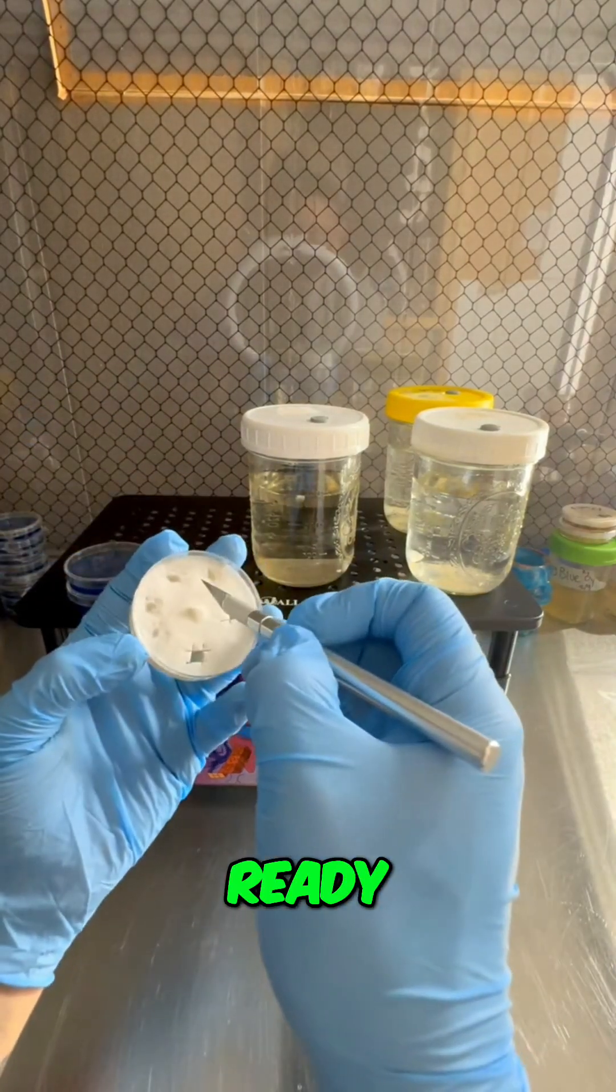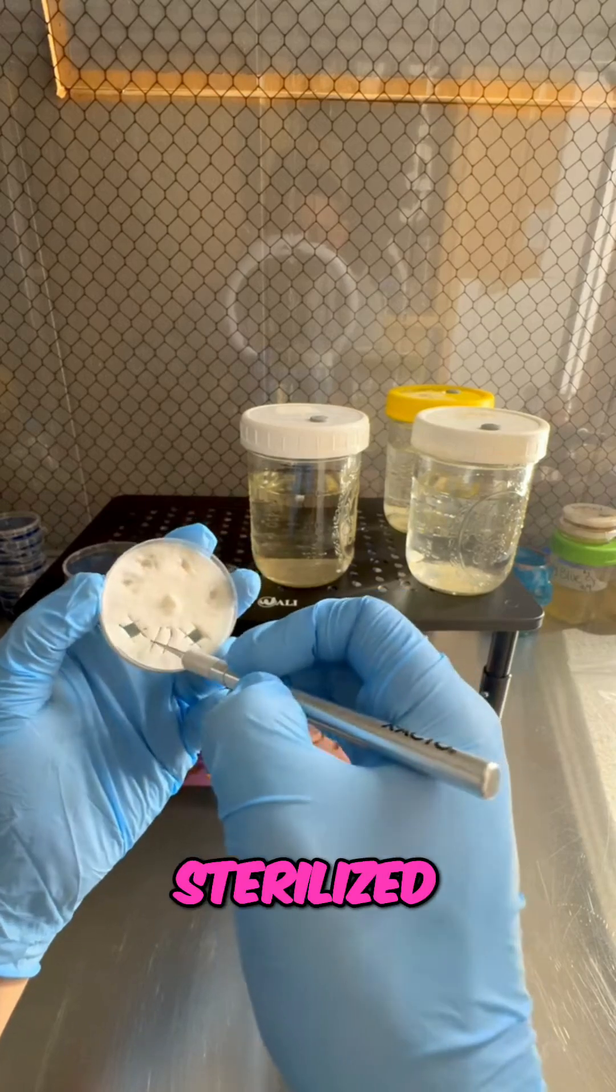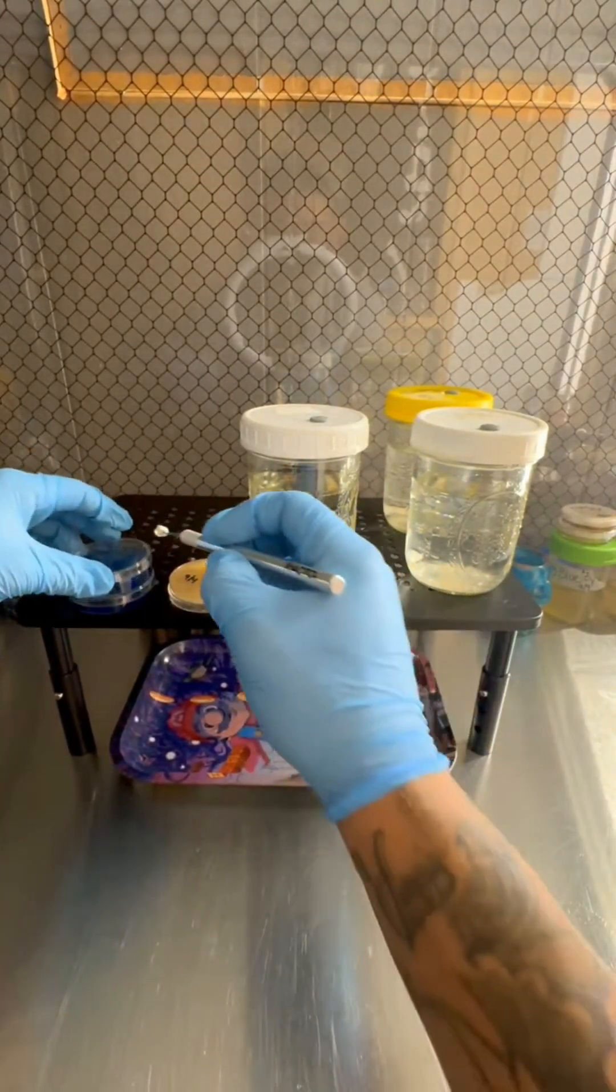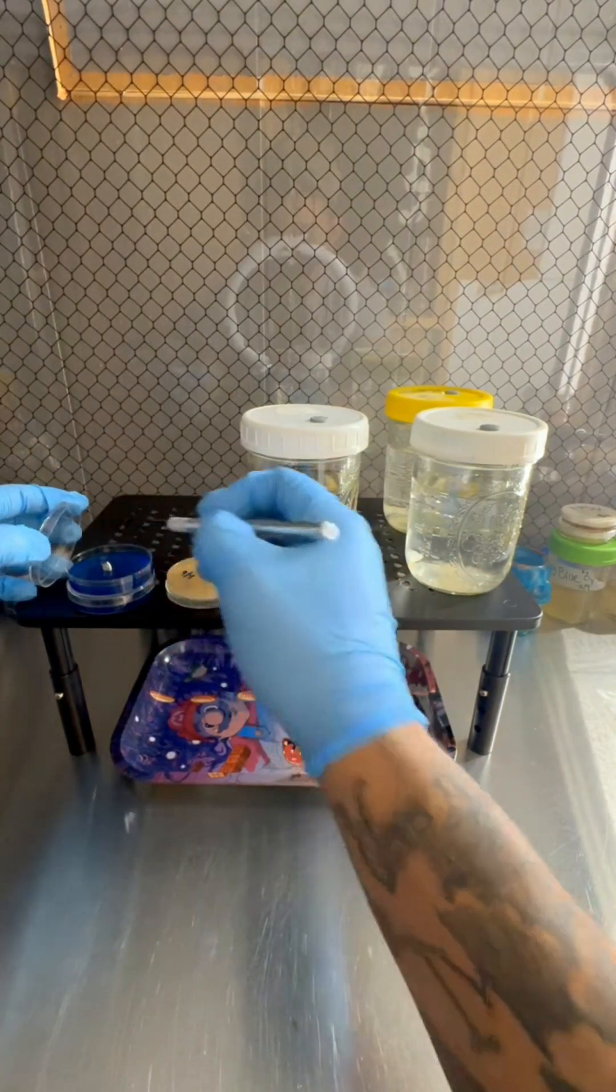We don't need to sterilize this, it's already sterilized. Just like that.